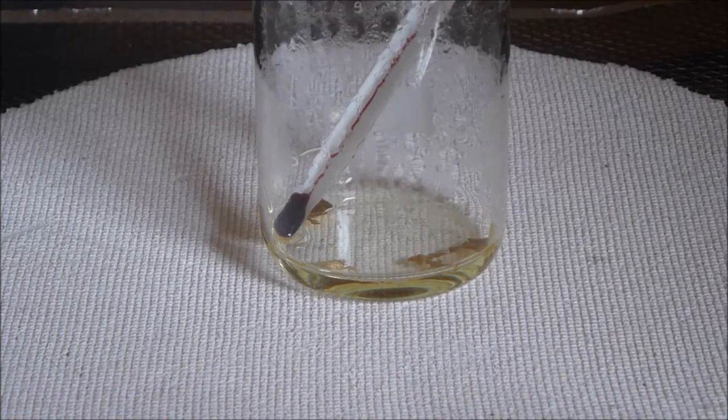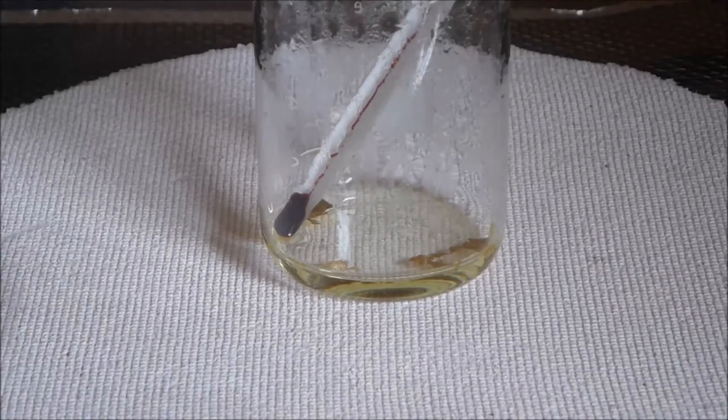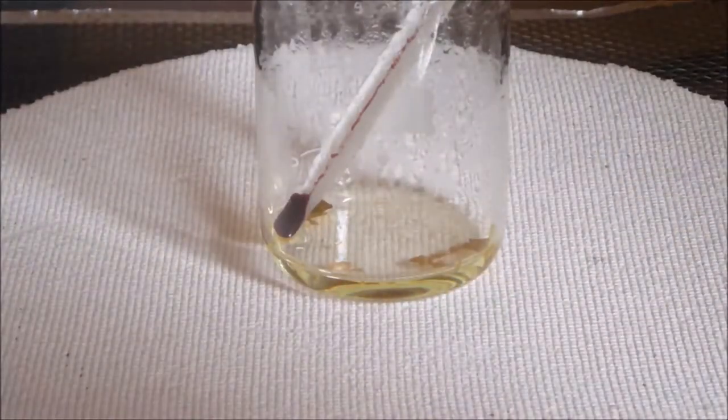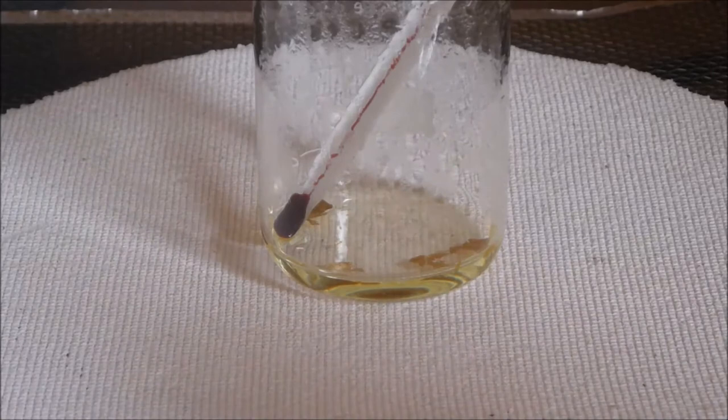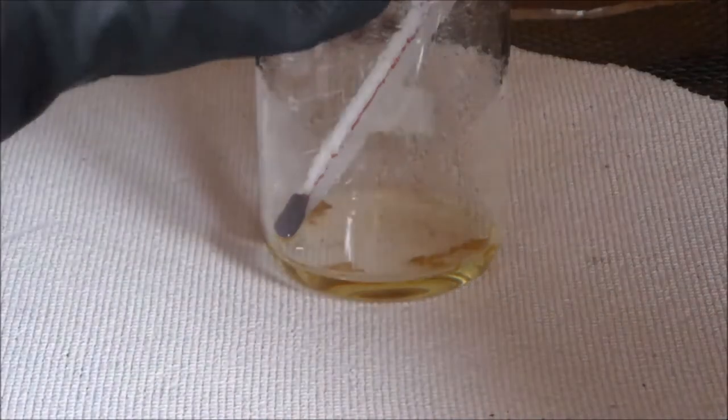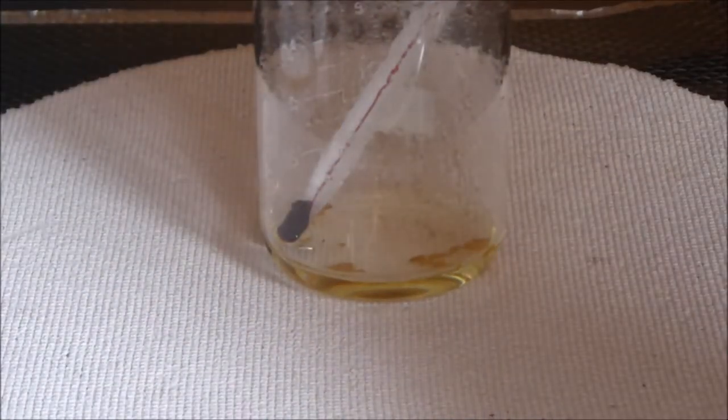Okay, so we've come up to temperature there. I'm just going to get a little bit of nitric acid in the pipette. We really want probably just one drop. I don't think we'll need too much. I don't think there's much gold there.